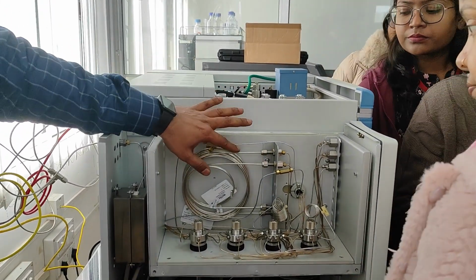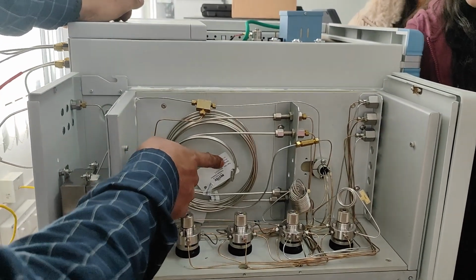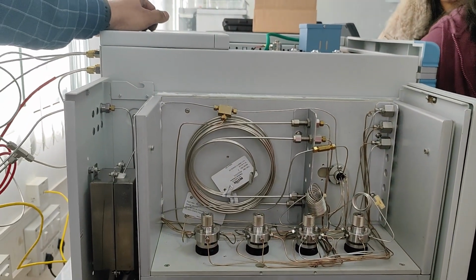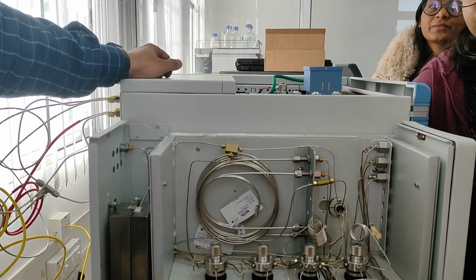This is the column. Column details will be seen. PPQ, PQ. It cannot separate oxygen and nitrogen. Poor separation for CO and CH4.